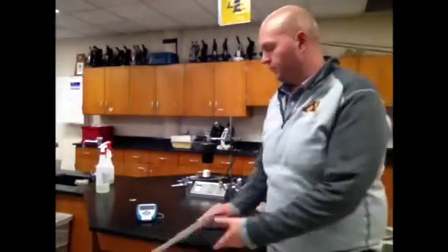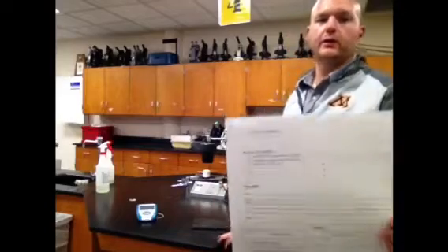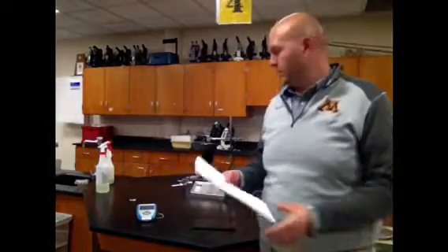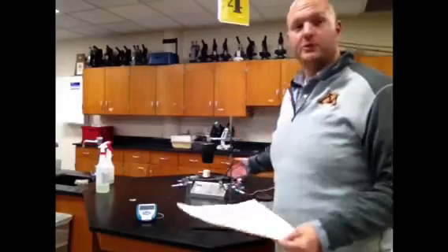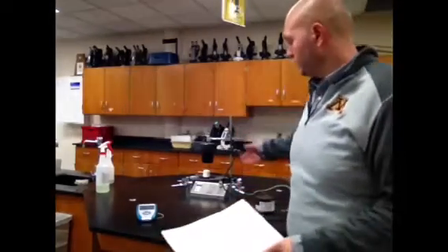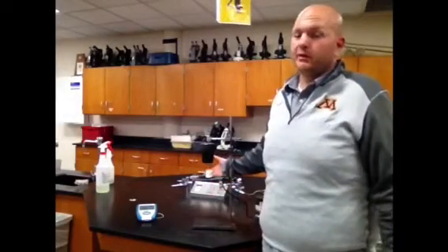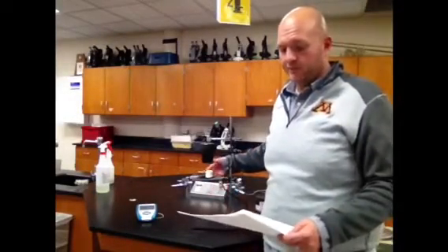Let's take a second to go through our variables, right? In our lab, we have three things we're looking for. There it is, right there: independent, dependent, and controlled variables. Look, that's backwards. Good luck reading that one. First, our independent variable is going to be what's different between each time we run the experiment. So the first time we run the experiment, we're using a marshmallow. The second time we run the experiment, we're using a cashew. So our independent variable happens to be the type of food.